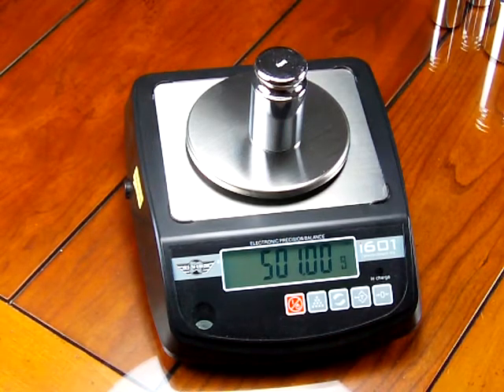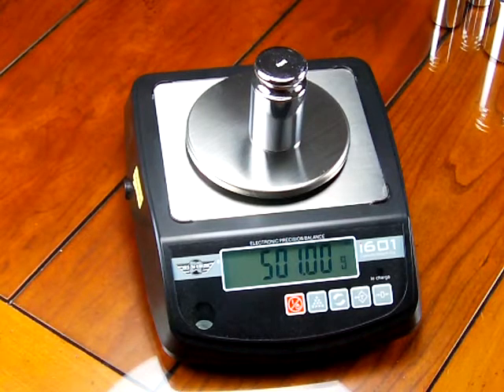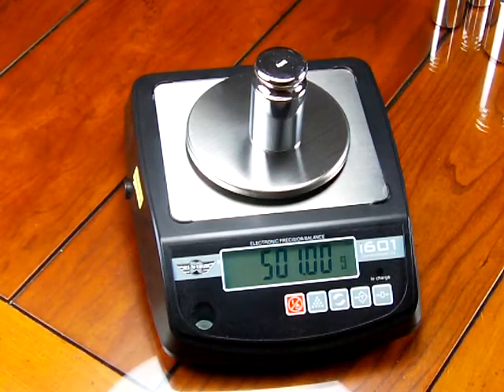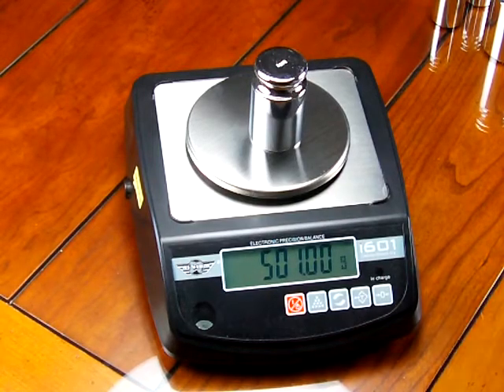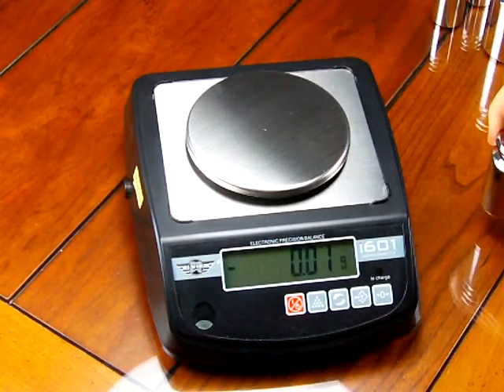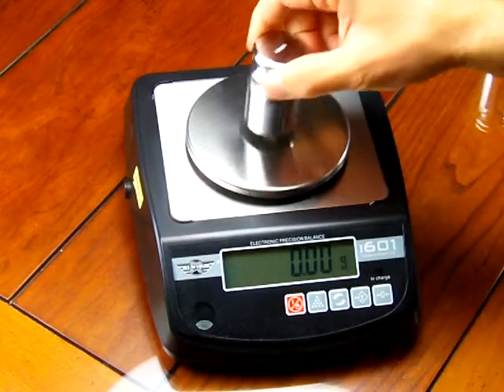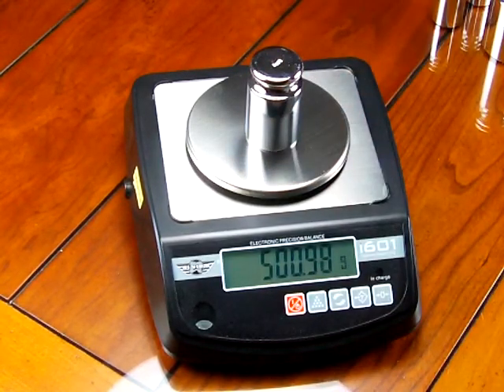For this particular scale you need a 500 gram weight and we highly recommend you purchase one because as you can see right now the scale is not accurate. It is very precise if I take the 500 gram weight and I put it back on, the scale reads 501 grams.